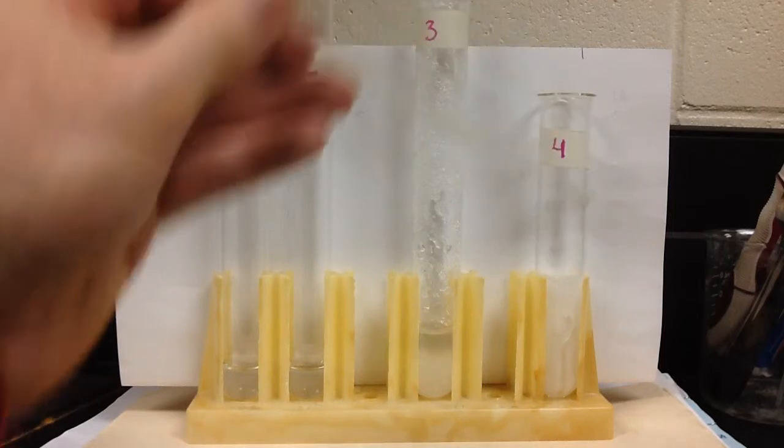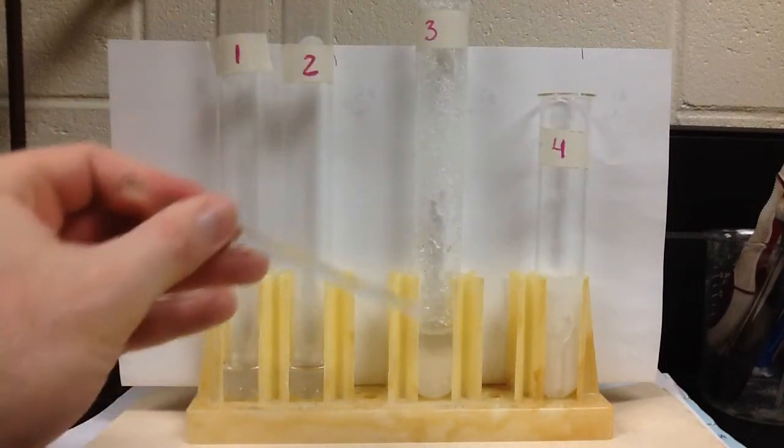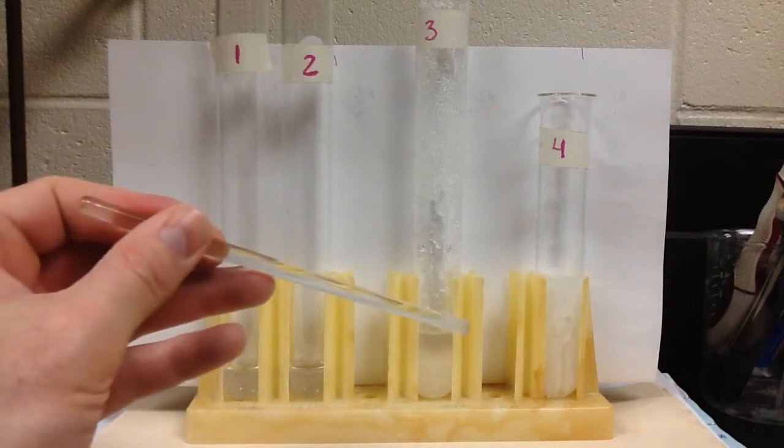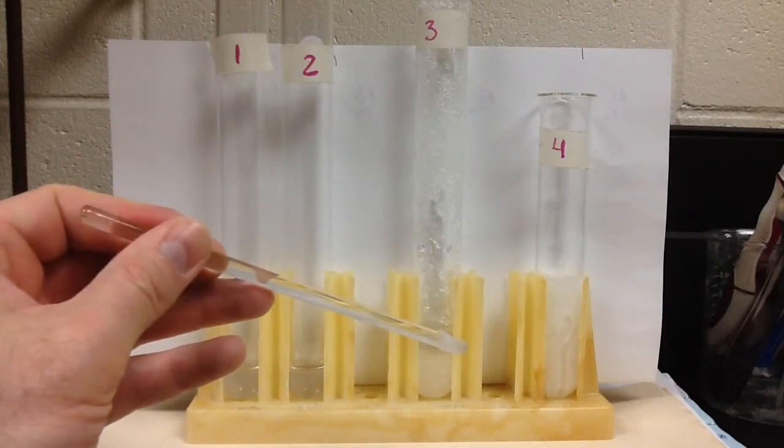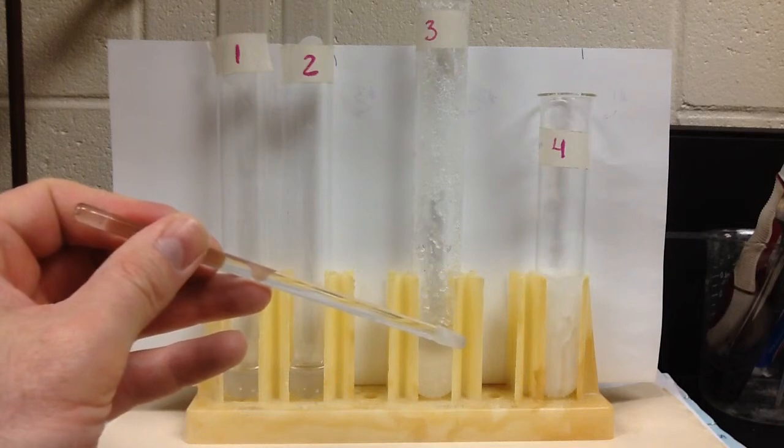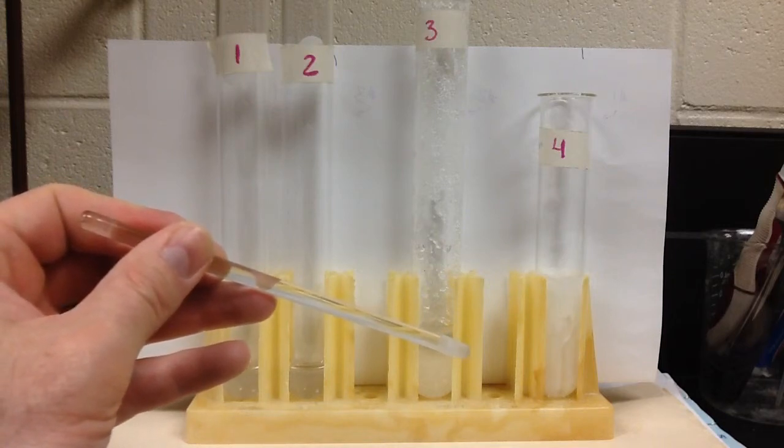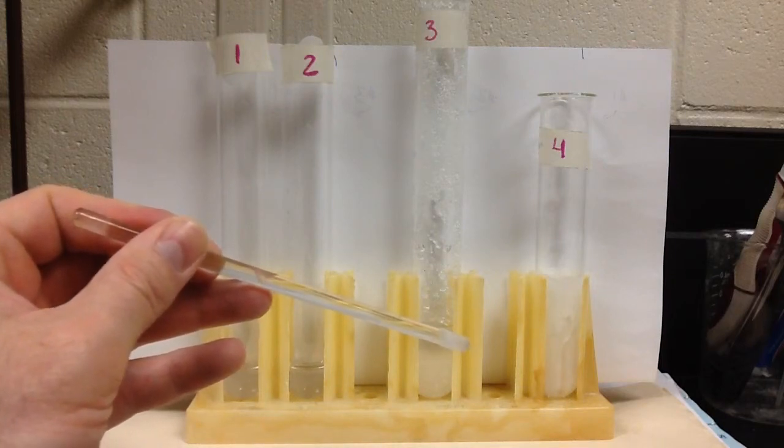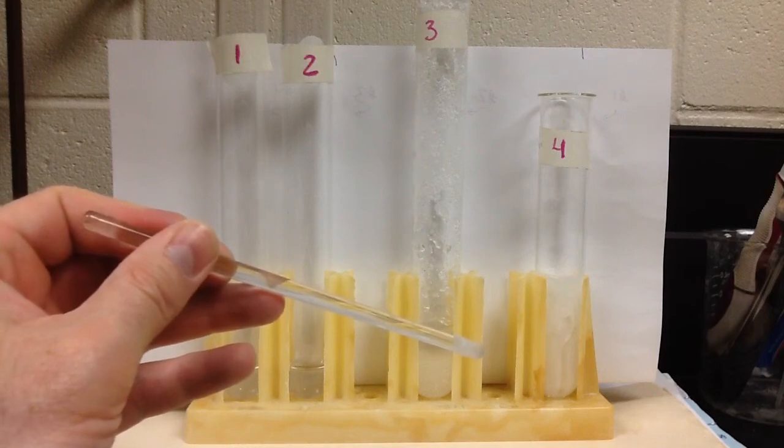So even though visually test tube three and four look different, we didn't change anything about what's inside the test tube. We still have the same amount of water and the same amount of solute crystals added to it. So hopefully this has been helpful in determining types of solutions.